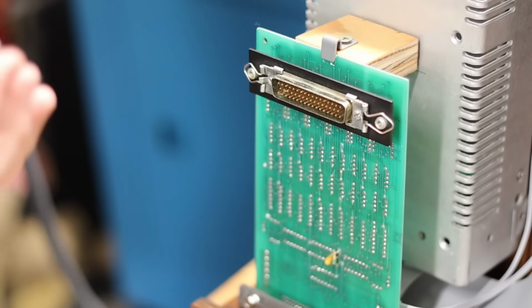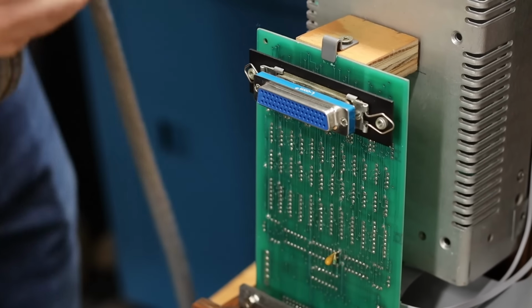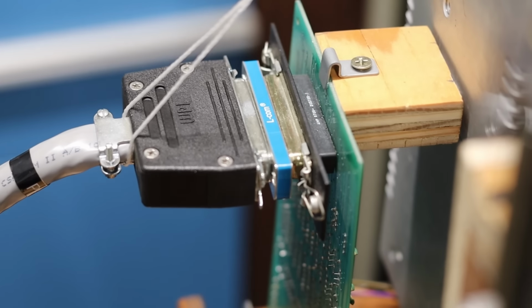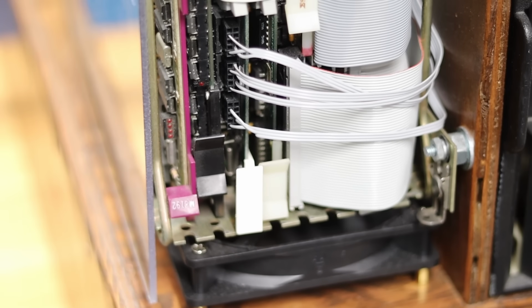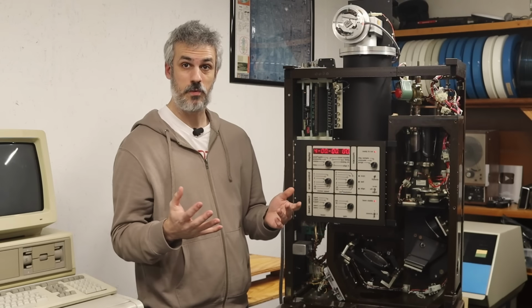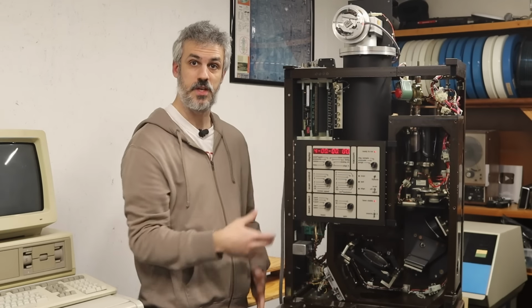So we've got a couple of things that we're slightly worried about. One is the gender changer on the cable. That absolutely should not have been necessary. The next is that there's serial communication between the PDP-1173 and the opto-isolator board. I've got RX and TX set up on that, but I could have that backwards, which would prevent any serial communication from making its way over to here.